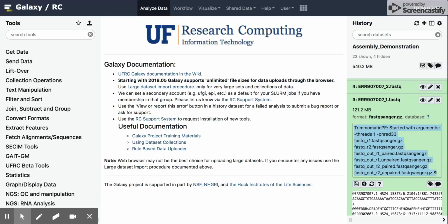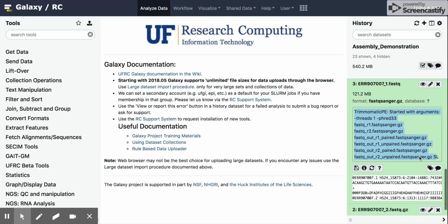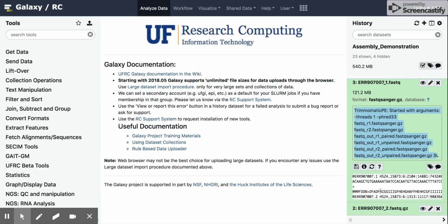If you were trying to reproduce this on the command line, those are the commands that you would run to replicate the analysis that we just did. And at the bottom is a peek of what the data file looks like. As you can see, it's a FASTQ file with our customary FASTQ header, the read, and then some metadata about that read that includes its quality score per base and quality score for the entire read length.